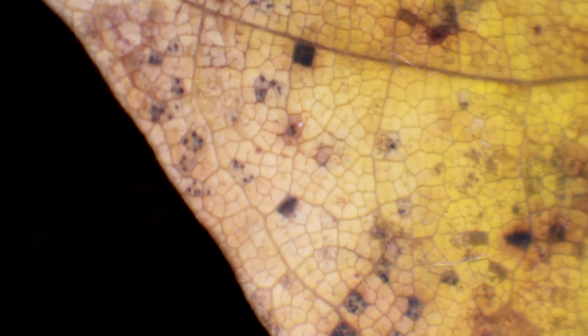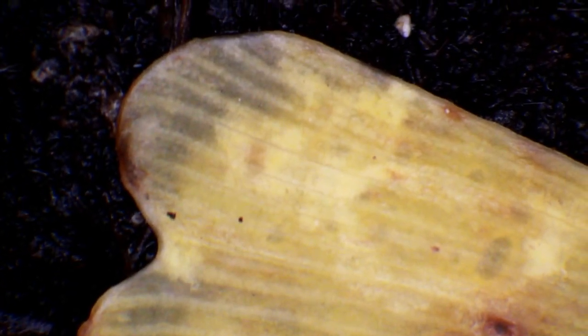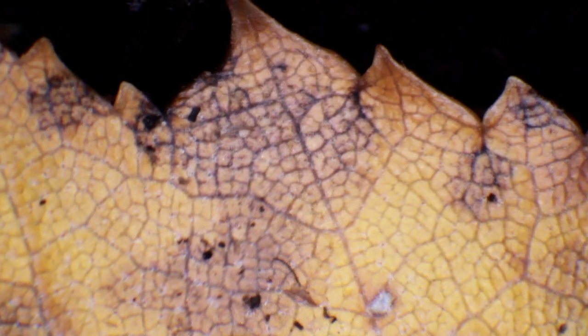Up to this point I had not seen any other animals yet, so I had to wait another day or so. The garden soil and ginkgo leaf now start to become a little more transparent, and I think the microorganisms are really happy. The garden soil is important because it contains spores of fungi, which increases the chance that the leaf starts to decompose. If you just leave the leaf in the container, the decomposition process will not take place as quickly.